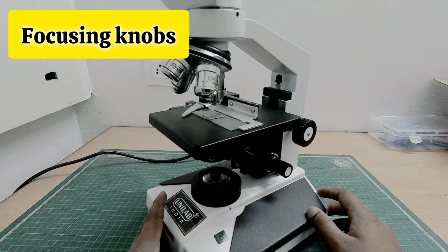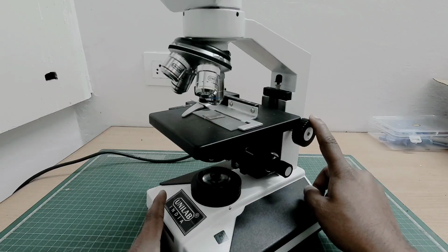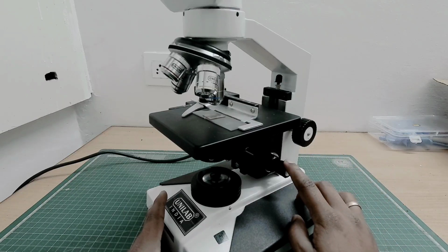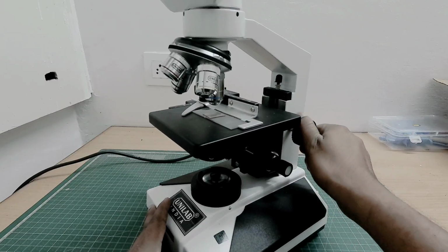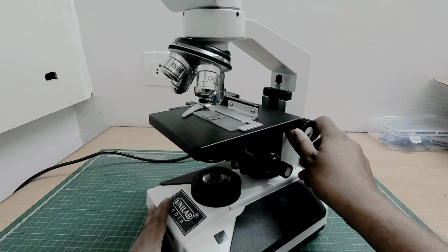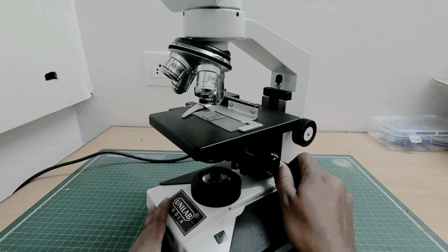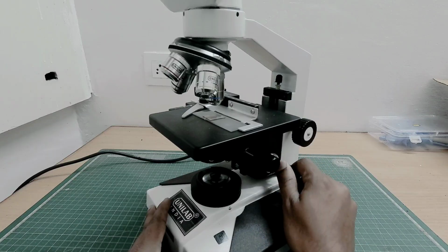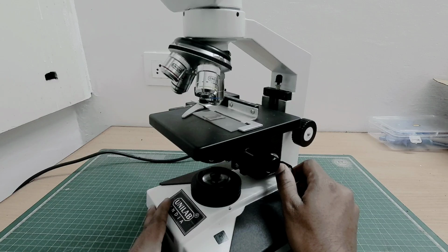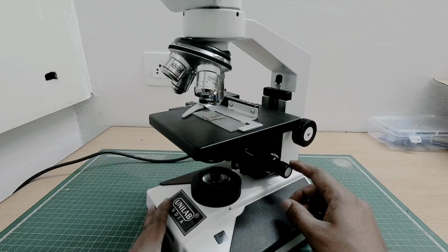So this is how the focusing mechanism works. It has two knobs. One is the coarse adjustment knob and this is the fine adjustment knob. The coarse adjustment moves the stage rapidly, used only under low power. The fine adjustment moves the stage minimally, required for sharp focusing under high power. Also, the depth of field decreases as magnification increases. So, at high magnification, only a thin layer of specimen remains in focus.